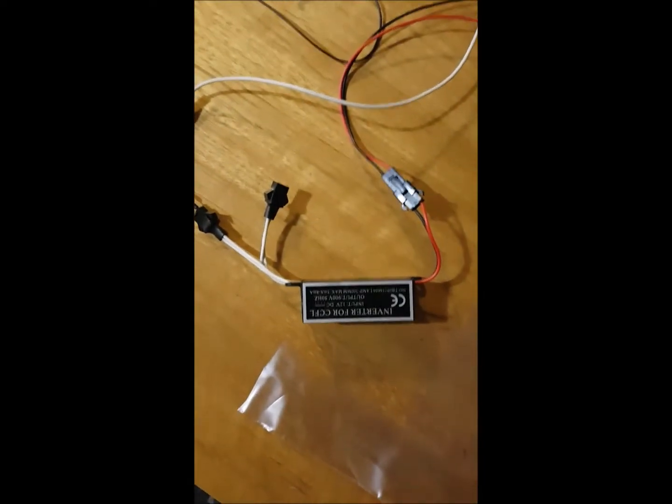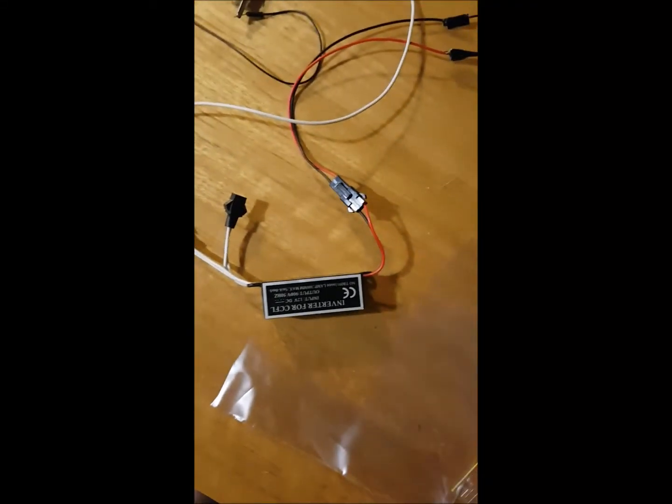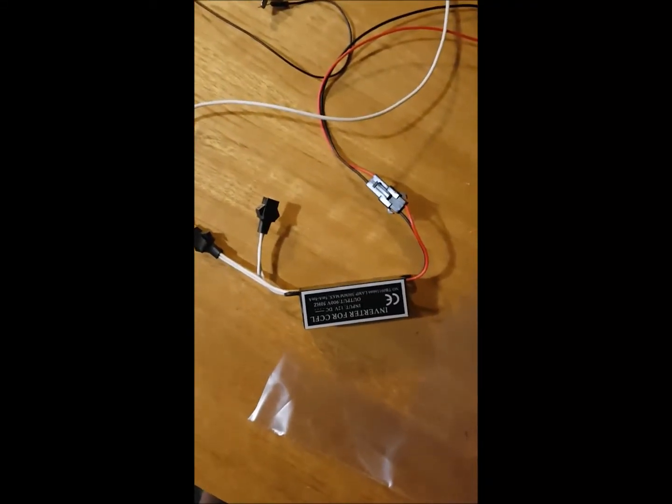These things should be putting out about 700 volts at the moment, but I don't own a meter that has a high enough input impedance to check that. You can see that we're well into there, in fact, you're just about to come out past there.